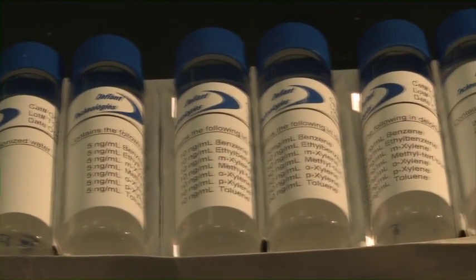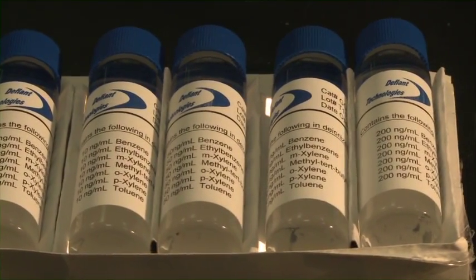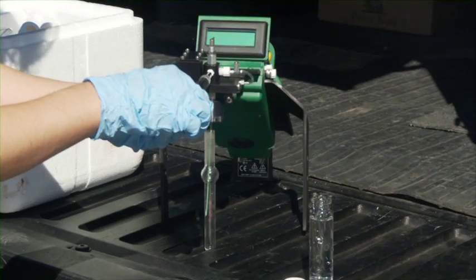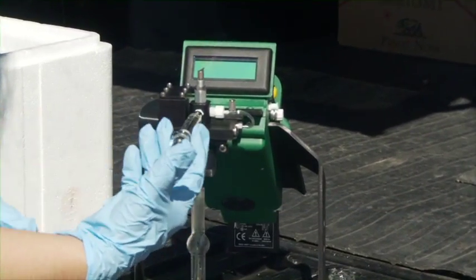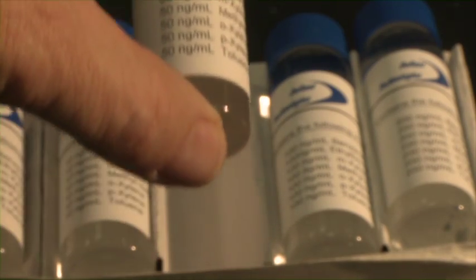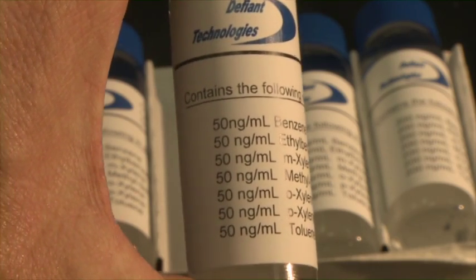The fundamental idea behind calibrating this instrument is that analyte standards of known concentration are tested on the instrument. That information is then used to predict the concentrations of unknown samples. For this demonstration we'll use a pre-made standards kit that is available from Defiant Technologies.